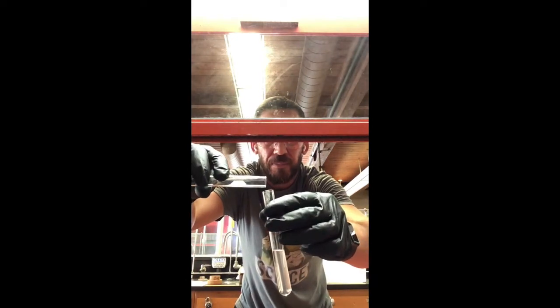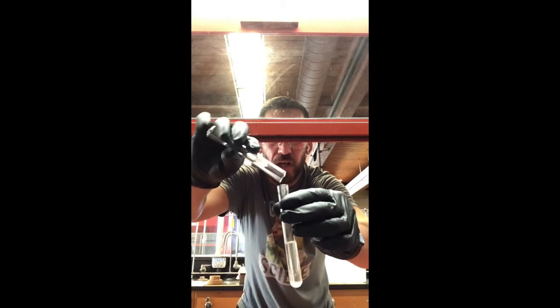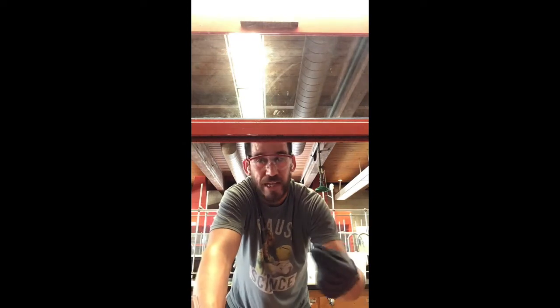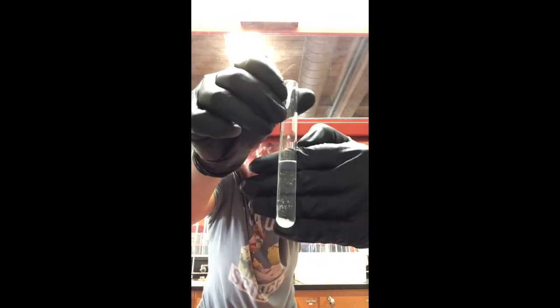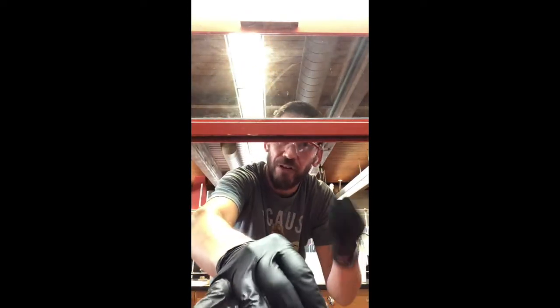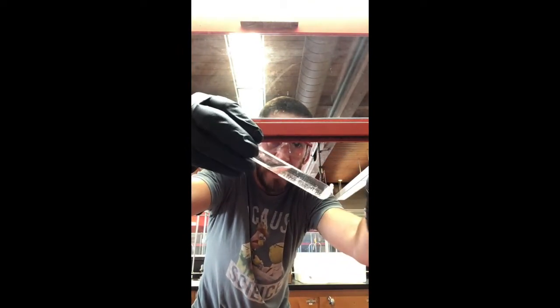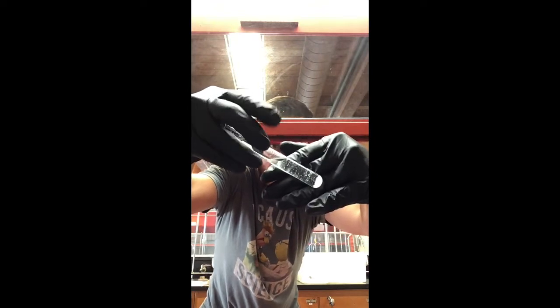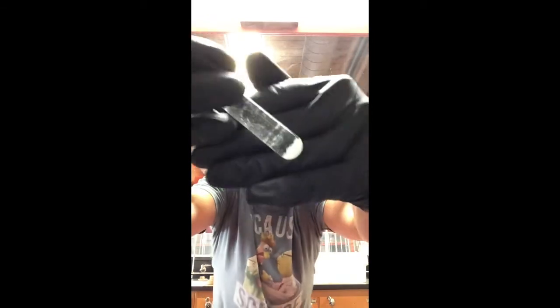So we're going to go ahead and pour that in there. The amount that you initially want to go with is just the end of a spatula. Scoop it in there. You see how we have some stuff stuck to the walls? Well, that's not free-flowing, right? It's stuck to the walls. And when I move this around, it's not flowing around as much as we would like.